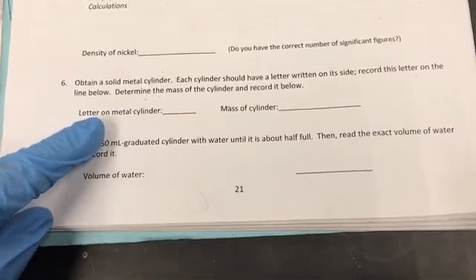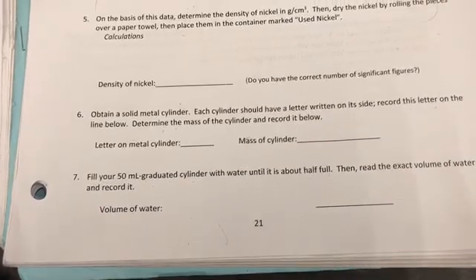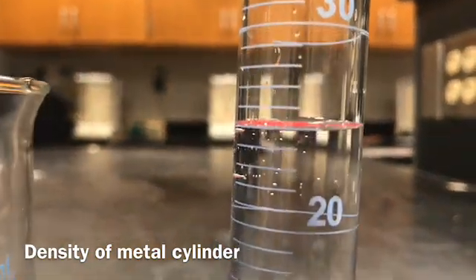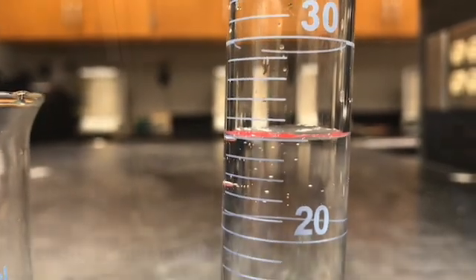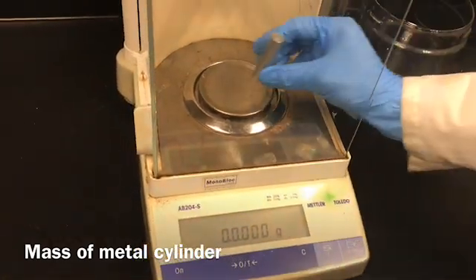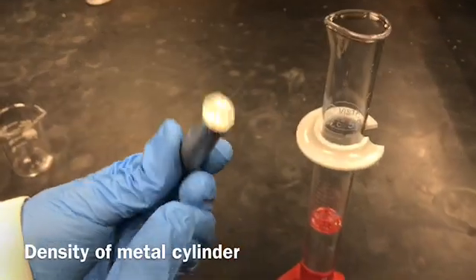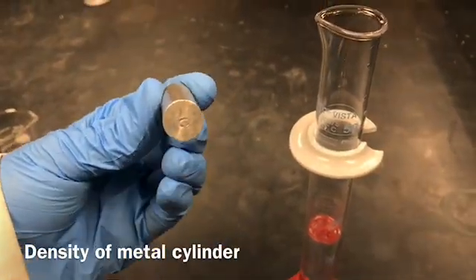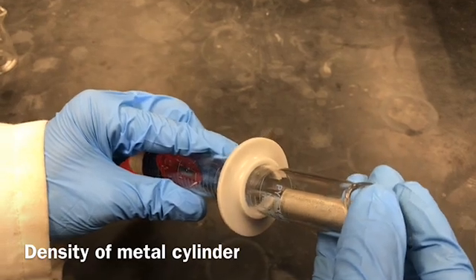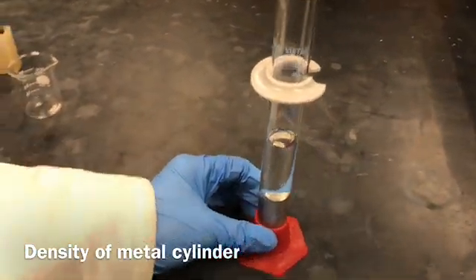Now we're going to work on the density measurements for the metal cylinder. I have added 25 milliliters of DI water into the measuring cylinder — note down that reading. I'm recording the mass of metal cylinder C. I'm going to roll it down very slowly into the measuring cylinder, and then you can record the volume displaced.